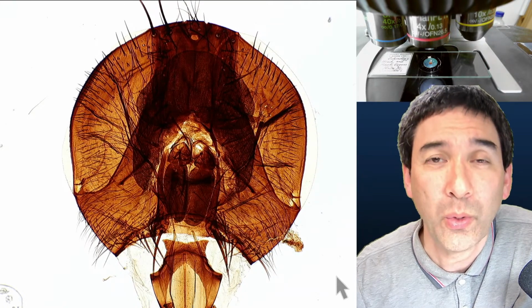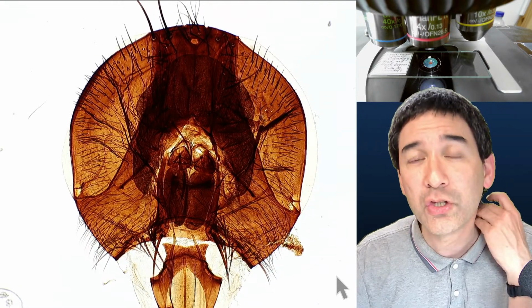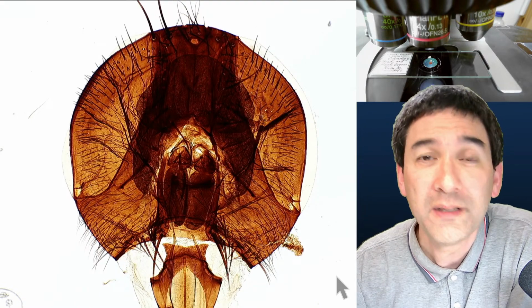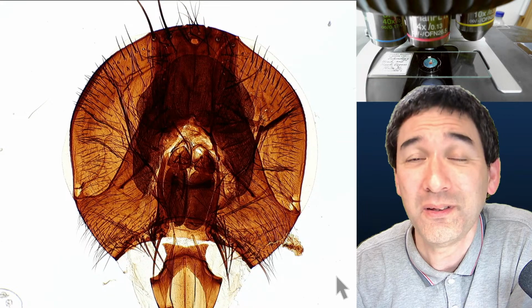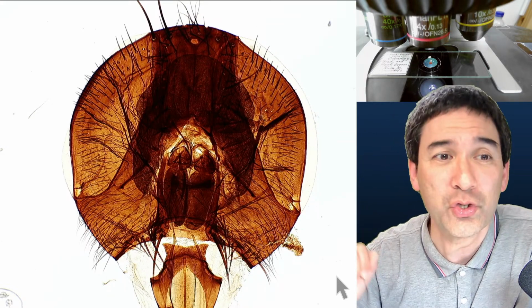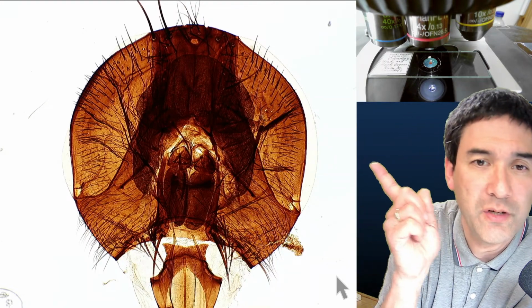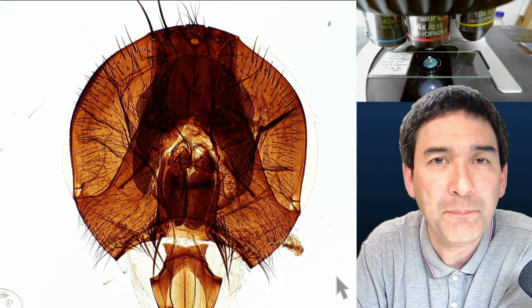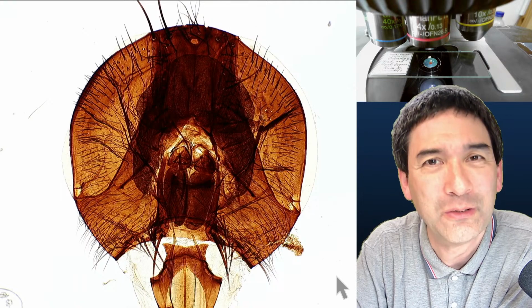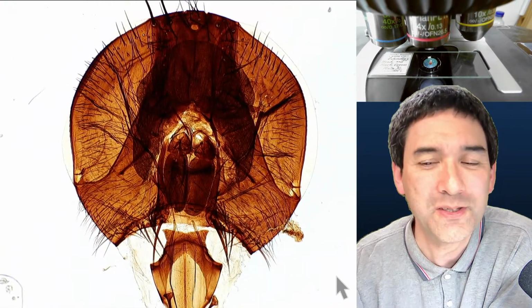You have to take away the water by placing them in alcohol, and then you can mount them. But if you actually want to look at insects using top illumination, light on top, then it's perfectly fine. When they're not transparent, they don't have to be, because you're just seeing the surface structure anyway. But for those insects like the head of the fly, if it is not bleached, then sometimes it's so dark that you're not able to see anything at all. But for top illumination, like with my stereo microscope, it's not necessary.